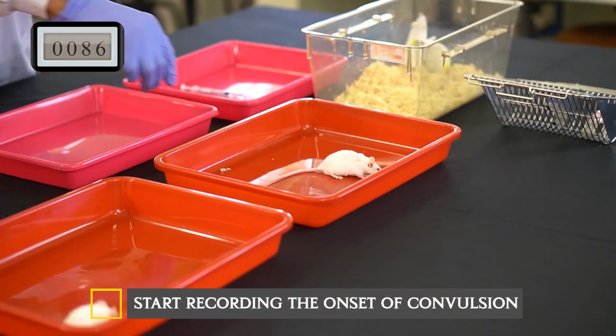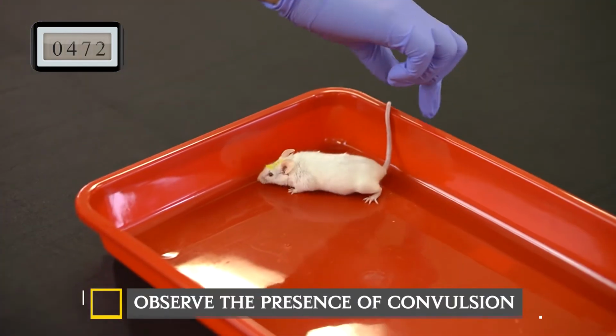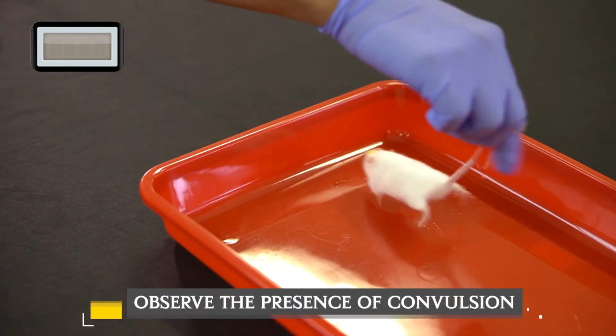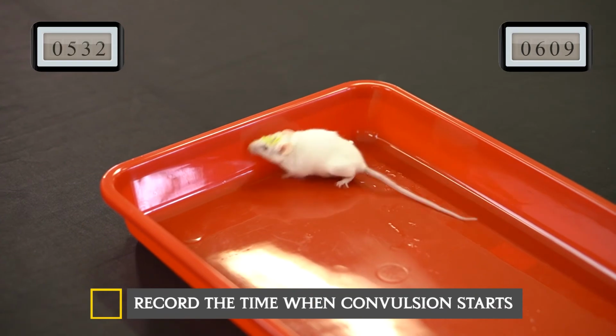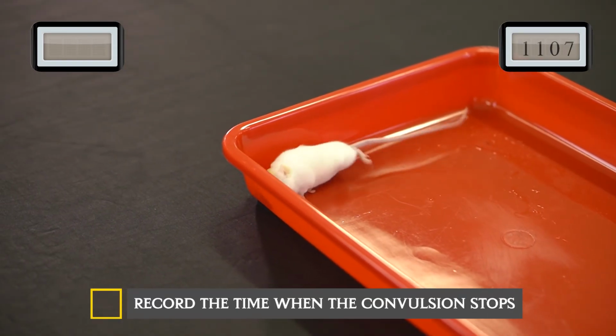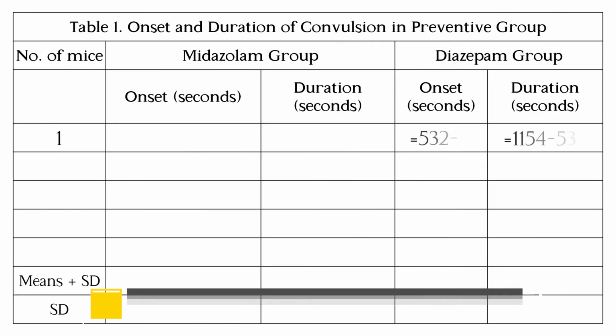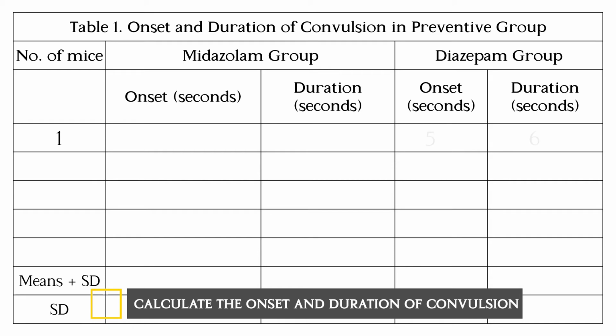Turn on the stopwatch to start recording the onset of convulsion. Observe the presence of convulsion. Record the time when convulsion starts. Record the time when the convulsion stops. Calculate the onset and duration of convulsion occurred in the diazepam group.